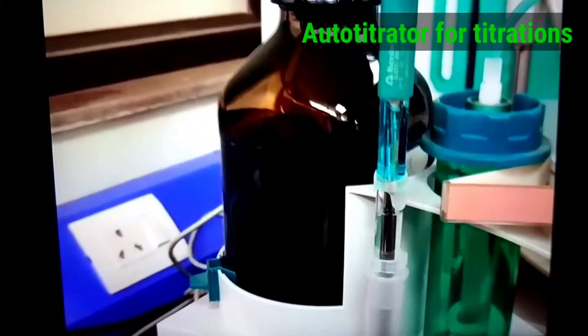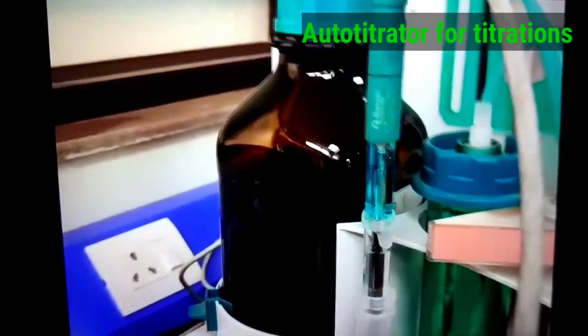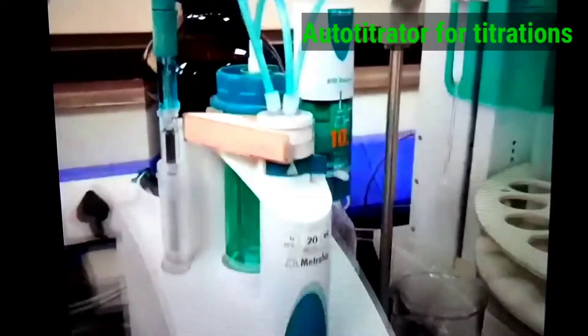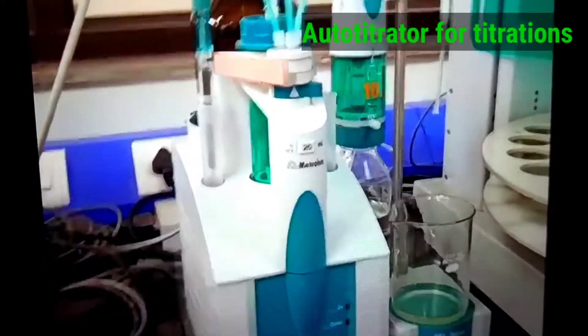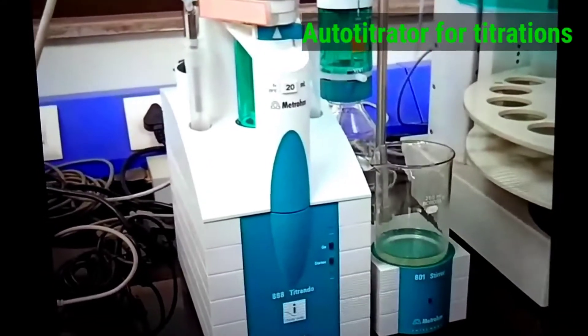You are measuring two types: one is P alkalinity, the other is M alkalinity. So here the sample is going on. We are taking here 0.02N sulfuric acid.